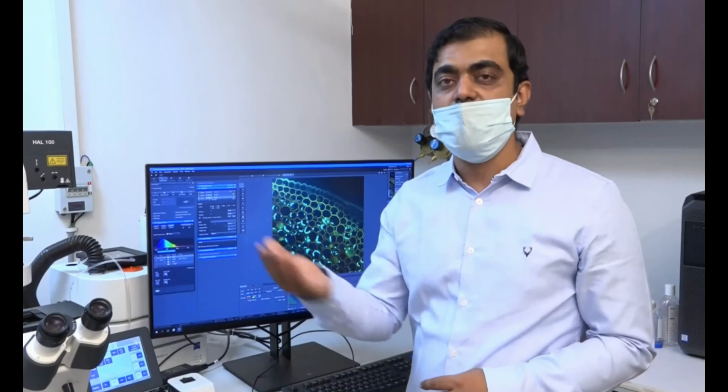So based on that, the software can say you can have a resolution in the Z-axis of 540 nanometer. So that is 0.54 micron, which you can see here. So the moment I click on the optimized part, you see the 86 slices.